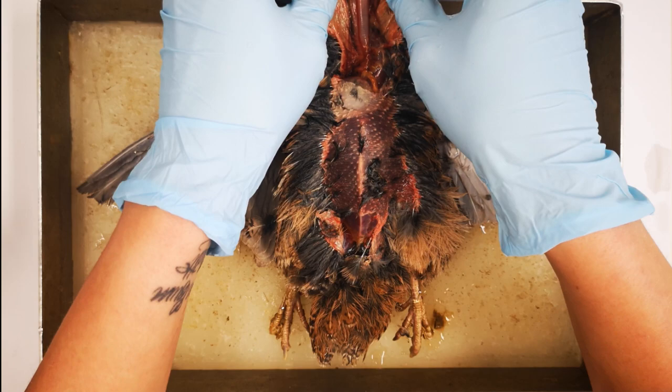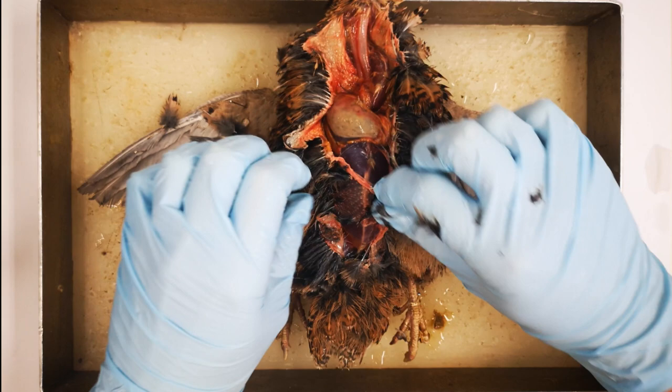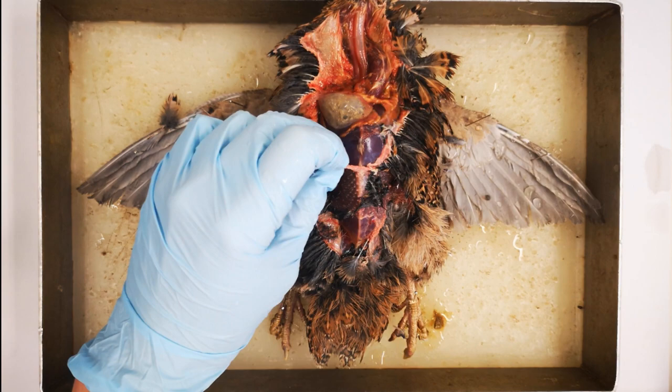The skin in the throat area, and in the area above the cloaca, can usually be carefully torn open by hand. This is preferable to cutting open these regions, as it can prevent accidental deep incisions. The remaining skin of small birds can also be separated by hand. However, fine scissors should be used to cut the skin in the chest and stomach area of larger birds.